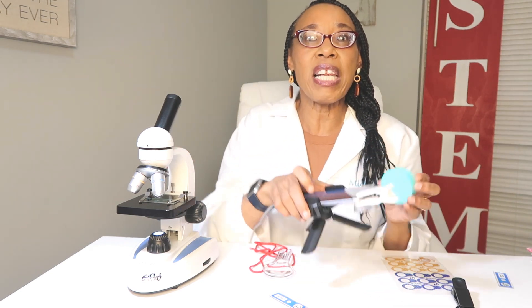But I have another microscope. This microscope is called the U-Handy microscope. This one is different because it allows me to use my telephone, my computer, or my iPad. All I have to do is take this clip, adjust it on the camera part of my phone, and open the app to U-Handy. U-Handy provides microscope kits for teachers, for homeschooling, or even if you just want a personal one.